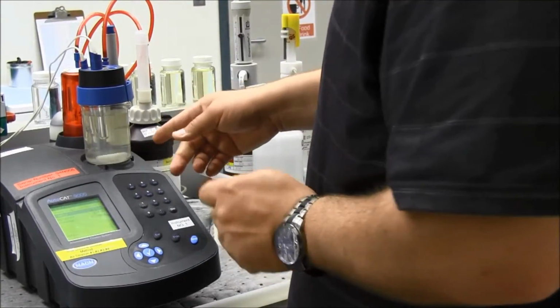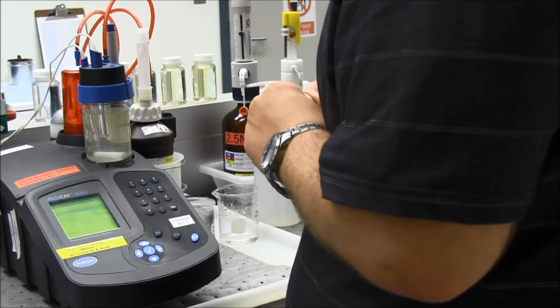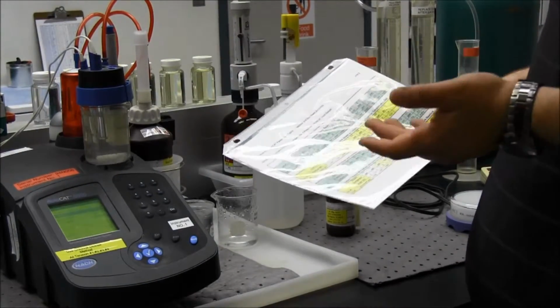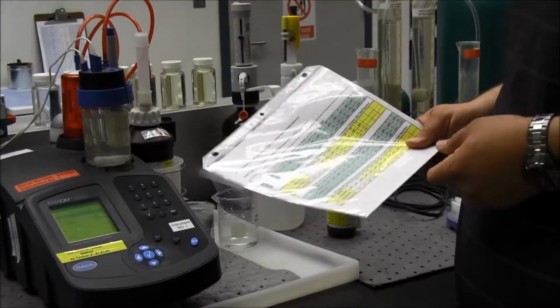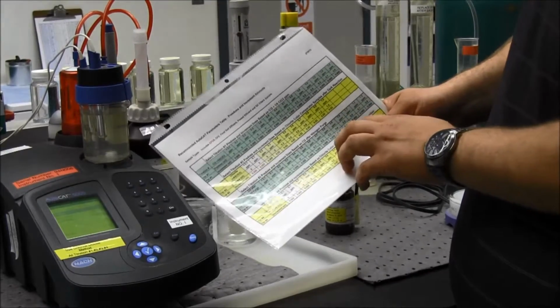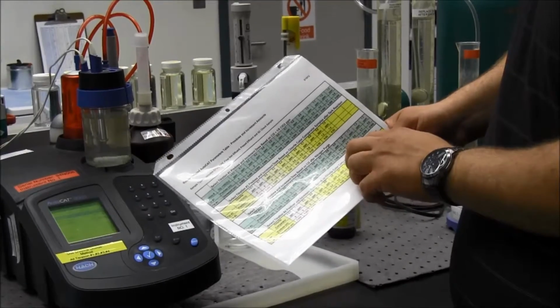Now here's where I generally know that I'm going to have roughly, I'm feeding at this plant about 0.9 parts per million of chlorine dioxide. So that's where I'm going to go on my chart. And what I'm feeding is 0.9 parts per million of chlorine dioxide. So it's going to give me my pre-dose and my increment again. So what I'm going to do is I'm going to pre-dose it.